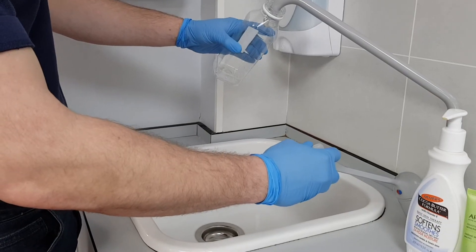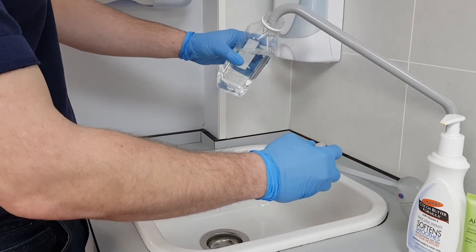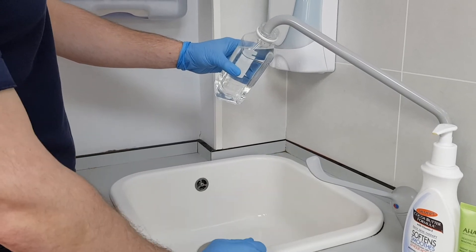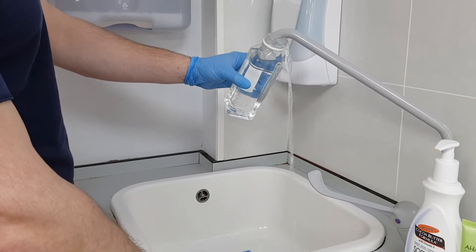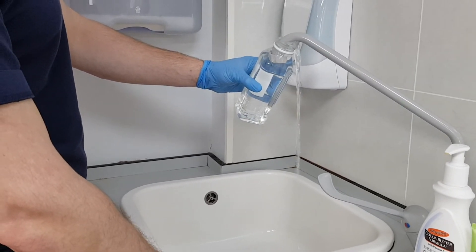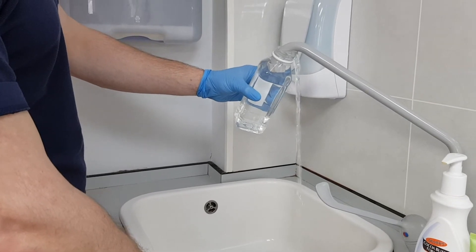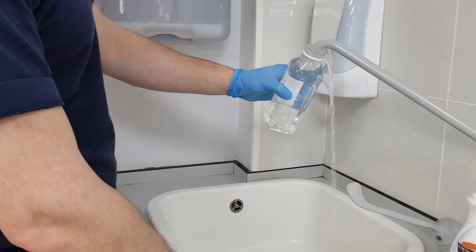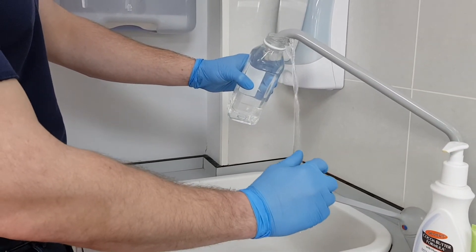Before demonstrating the test we would like to talk quickly about sampling. It is important to remember that chlorine dioxide is a gas and can easily be lost from water samples through agitation. So don't sample from outlets that spray the water into your container. Take the sample with minimal agitation. We recommend that you fill your sample container until the tap end is submerged and then continue to overflow the container for several volumes. This can minimise the loss of gas caused by splashing.